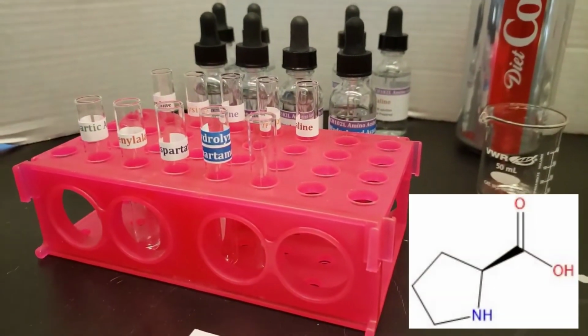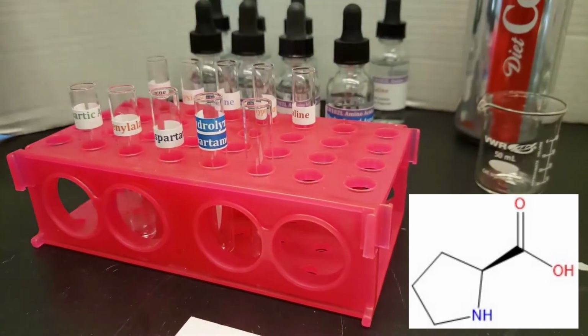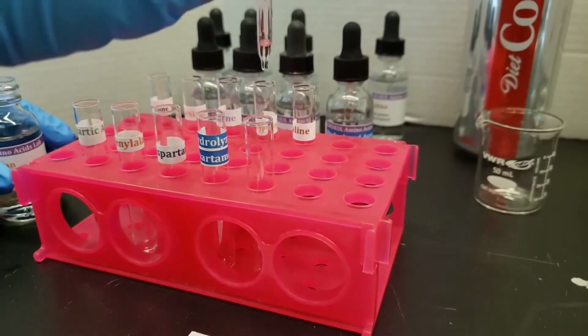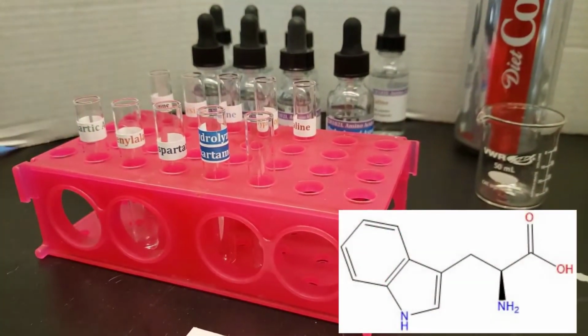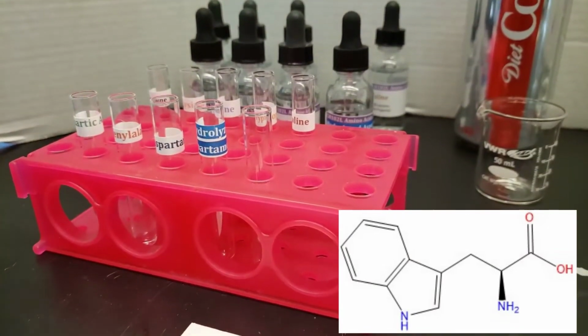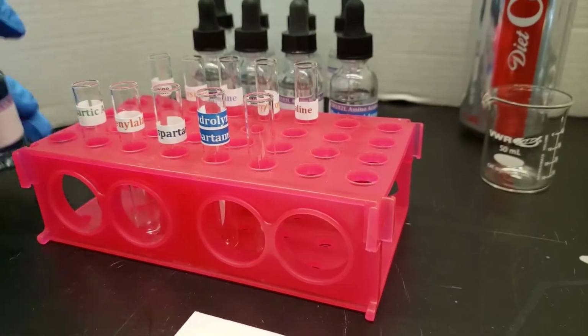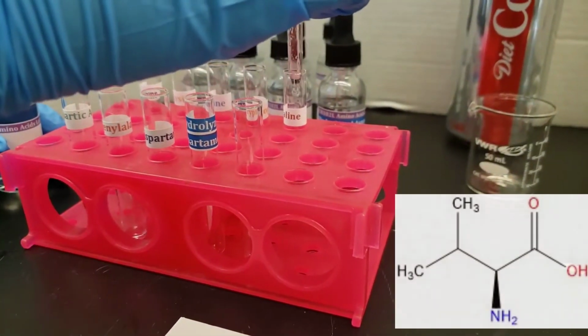The third one is proline. And then tryptophan. And valine.